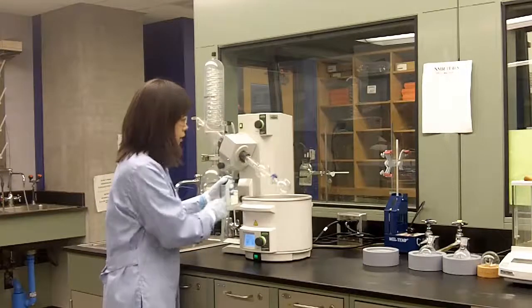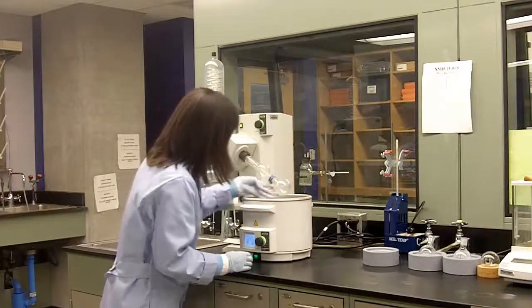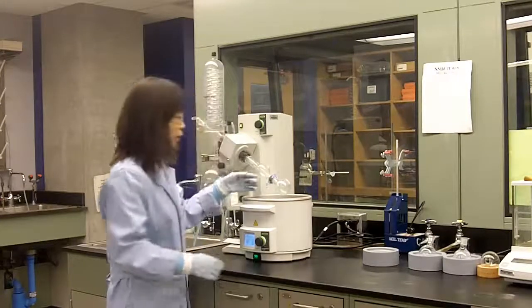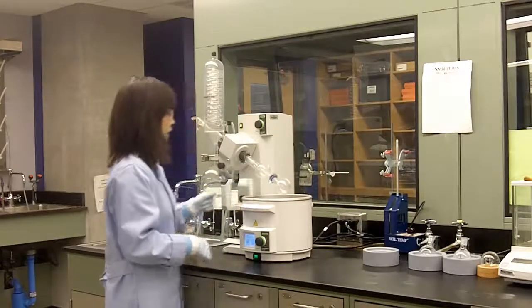Okay, so let's raise it up. All the solvents are gone. Actually, it's oil coming out as a thin film inside the flask.